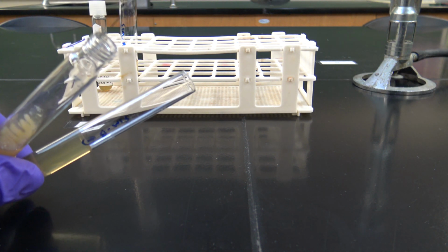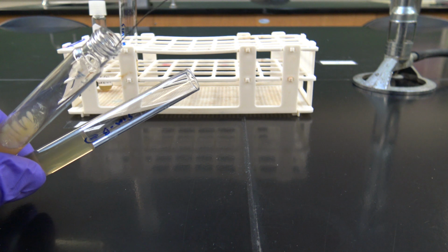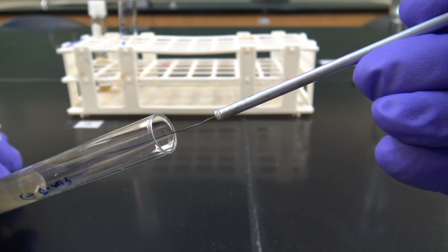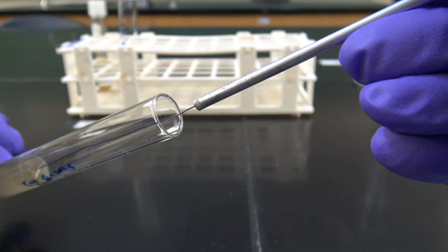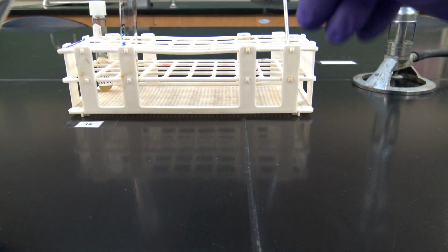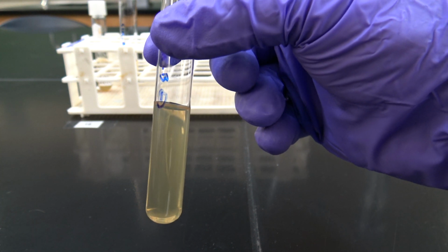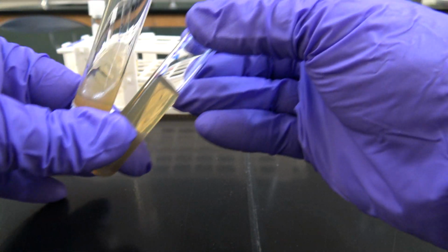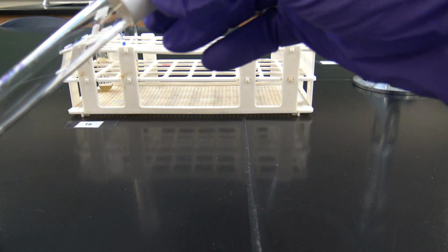So I'm going to grab some cells from here, and then gently go down into the middle of this tube. Like that. Sterilize the loop. And you can kind of see right down the middle there where I went down with the straight loop. So that looks good. I'm going to sterilize the lips of these tubes in the Bunsen burner again, because we're done with the tests.